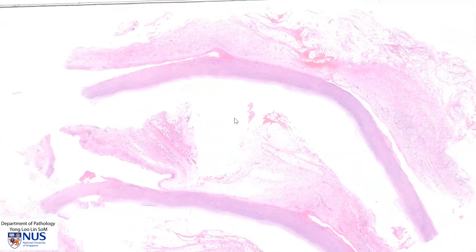In summary, this is an example of an aortic dissection, where we can see that there is a split or dissection in the tunica media by blood tracking into the wall of the aorta. Thank you.